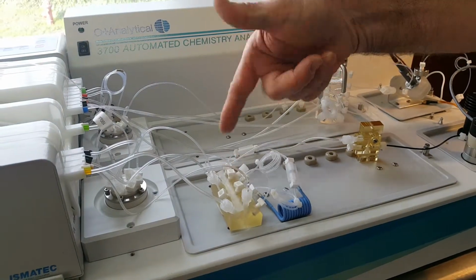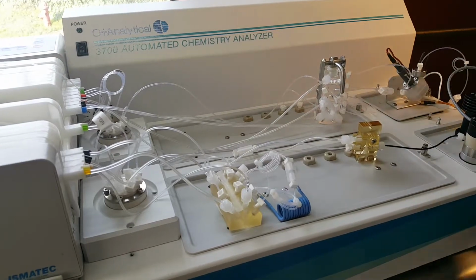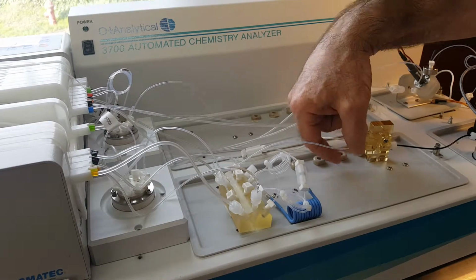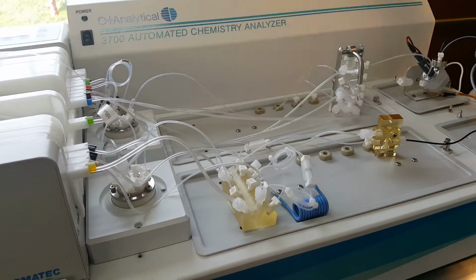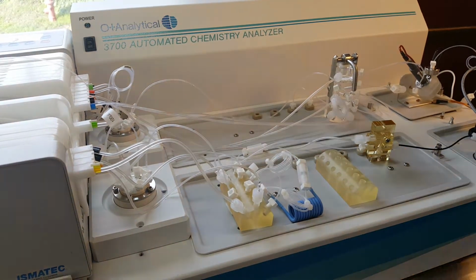Just imagine you were to cut every one of these, but instead of being sort of spread all over, now it's just in one. If you do want to remove it, you're just going to take the tubes off and take this away, disconnect it from there, and change. You also, in this configuration, could have, say, a phosphate cartridge here.